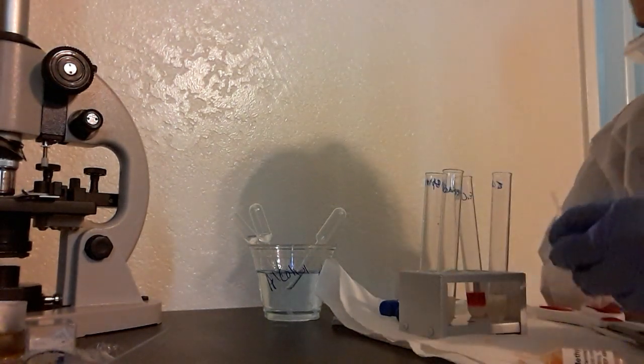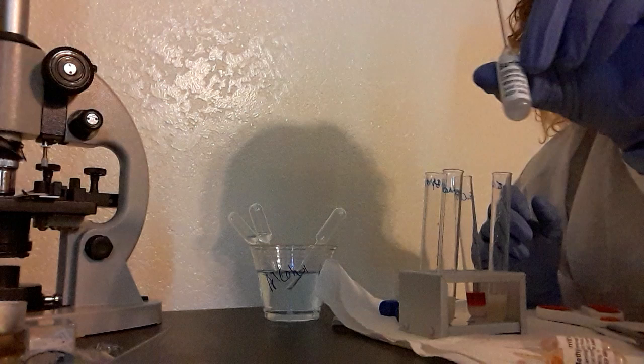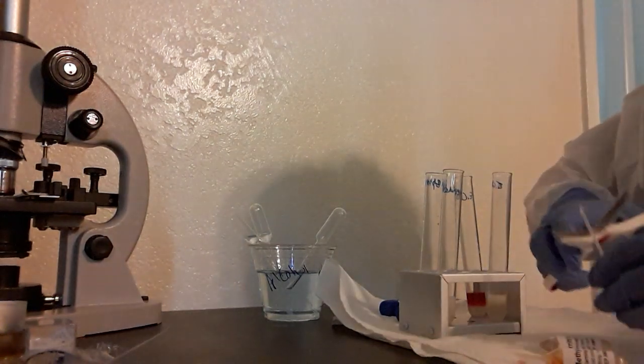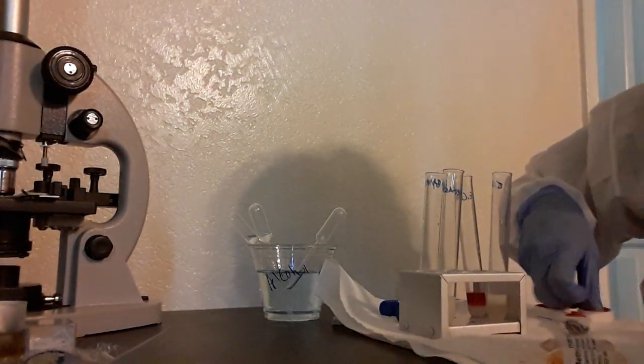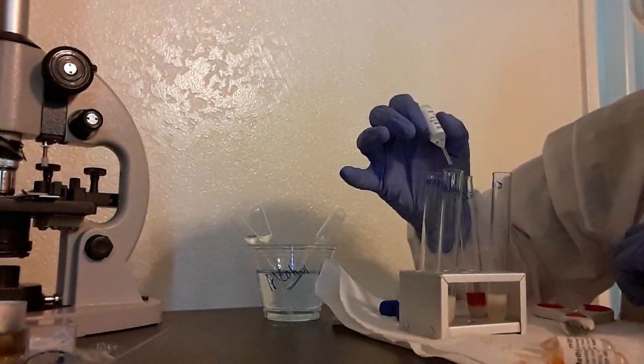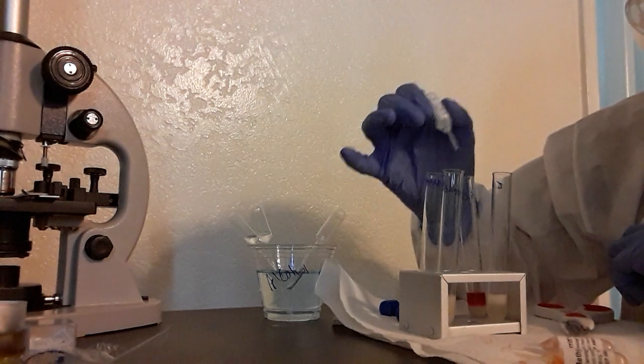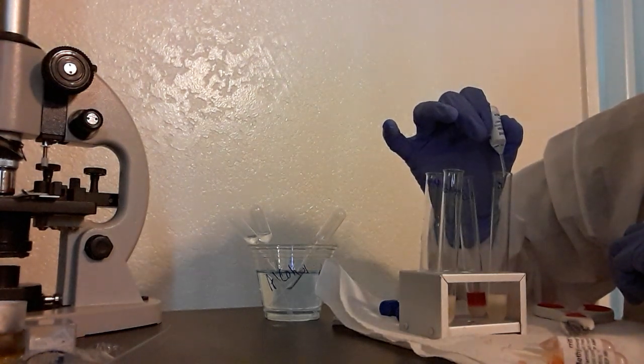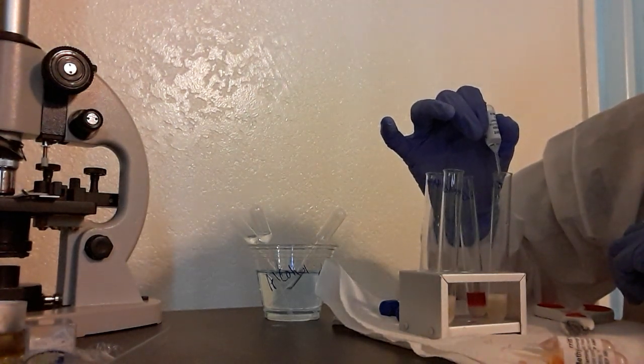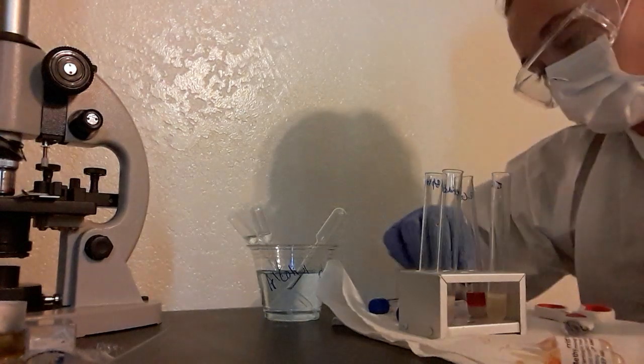Alright, and then I also got to do Barrett's B. So we're going to cut the top off, and this is only going to be four drops in each one. One, two, three, and four, and one, two, three, four, and done.